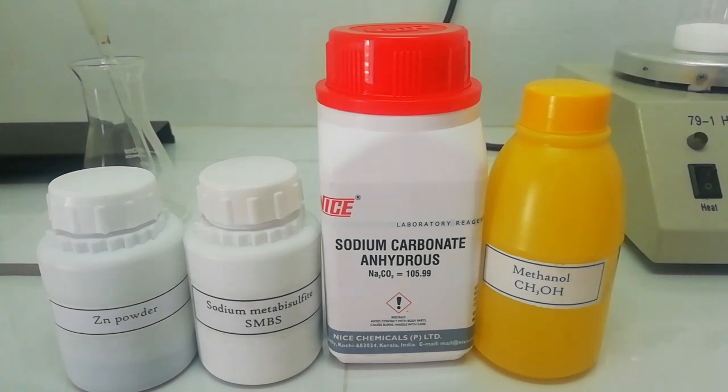Besides sodium carbonate, we need methanol, sodium metabisulfite, zinc powder, and some hydrochloric acid.